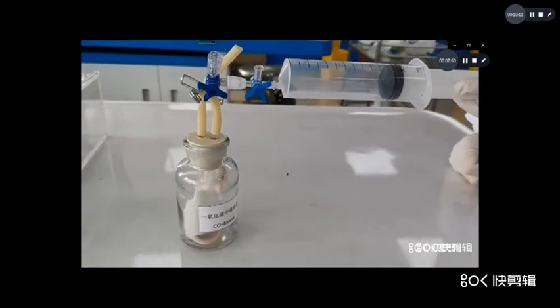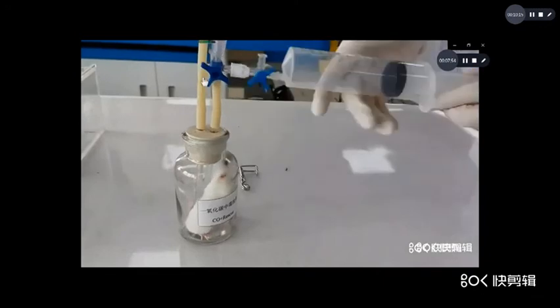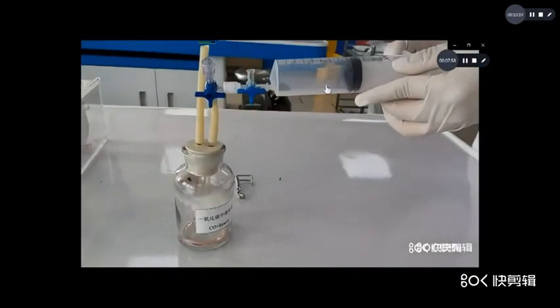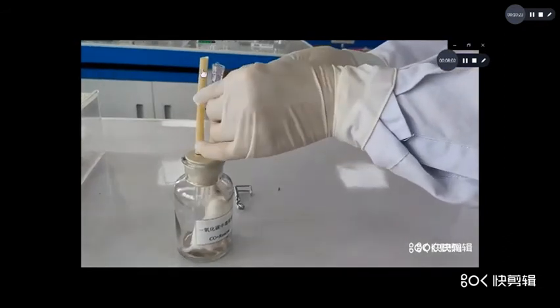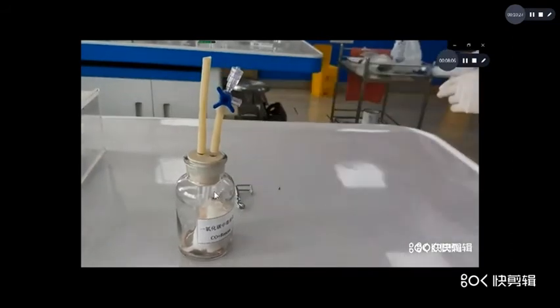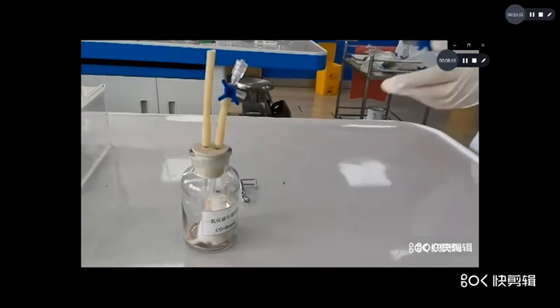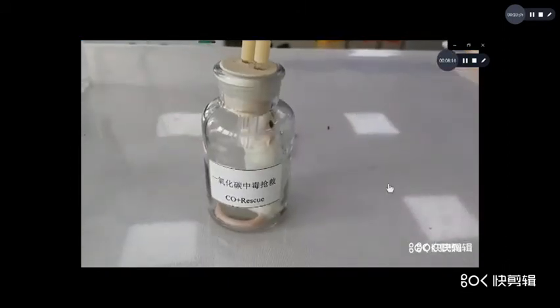After collapse, inject the oxygen. Now it must be open because there is more oxygen. If it is closed, maybe it will lead to the bottle breaking. So you must open it.